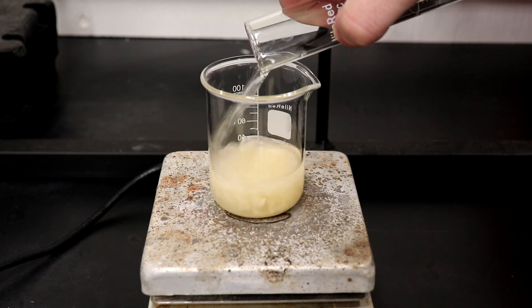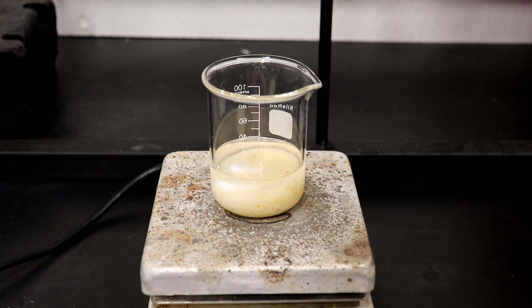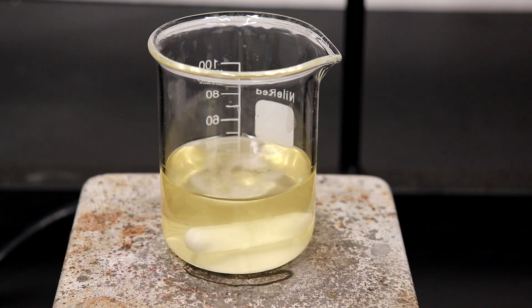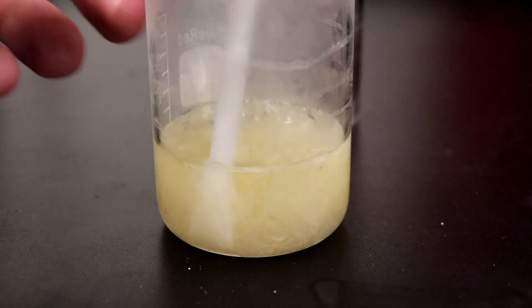After recrystallization, the product weighed 5.1 grams. However, when I took the melting point, it was 90 degrees Celsius, with the theoretical being 107 to 108 degrees Celsius. This led me to believe that there was still quite a large amount of solvent remaining in the product.